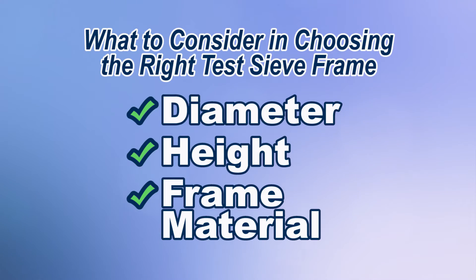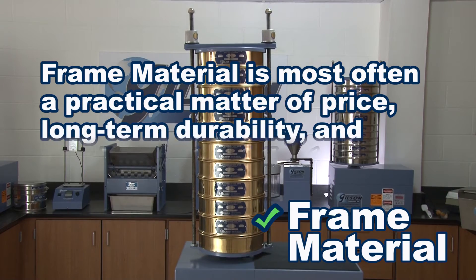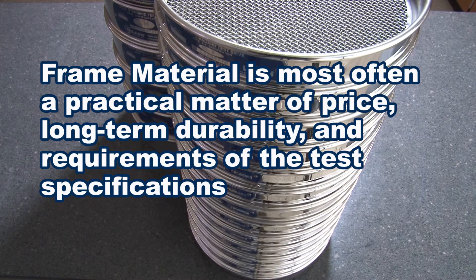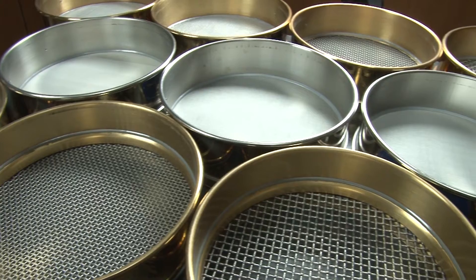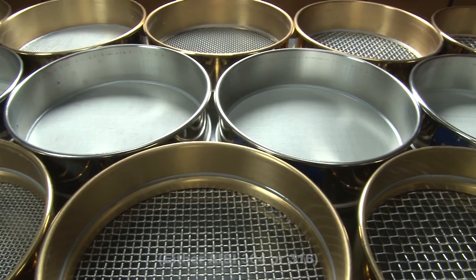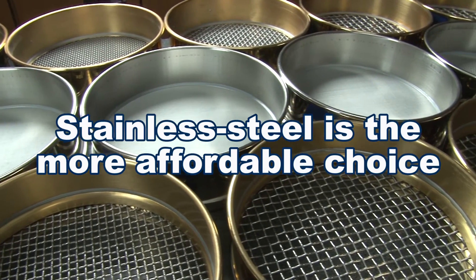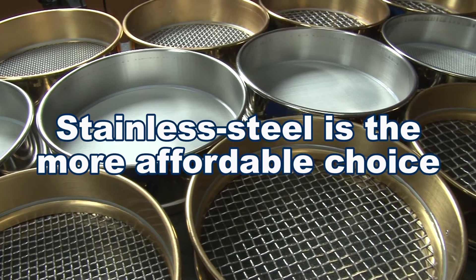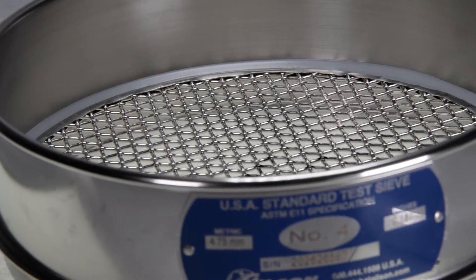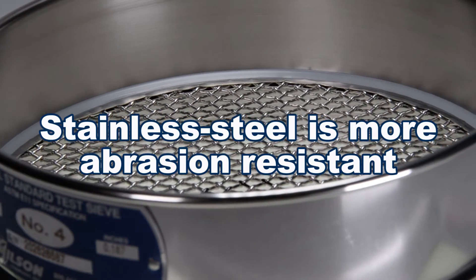Selecting a test sieve's frame material is most often a practical matter of price and long-term durability, but also the requirements of the test specifications when indicated. For many years, brass has been the more affordable choice over stainless steel. Today, however, the cost of copper material in brass has made stainless steel the more affordable choice. Additionally, stainless steel is more abrasion resistant than brass, which is a softer metal.